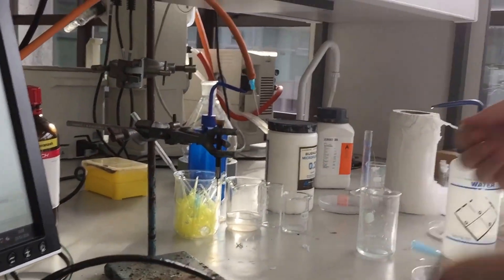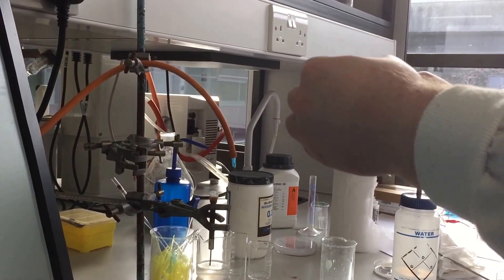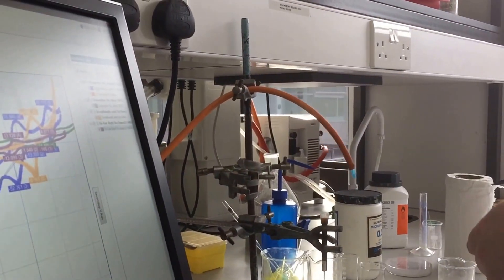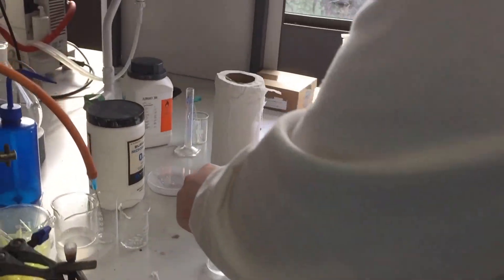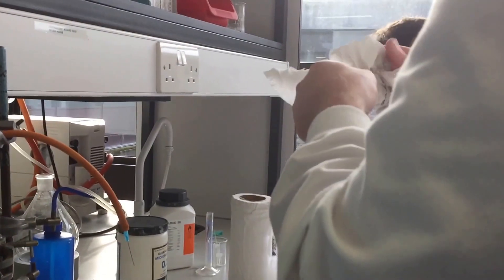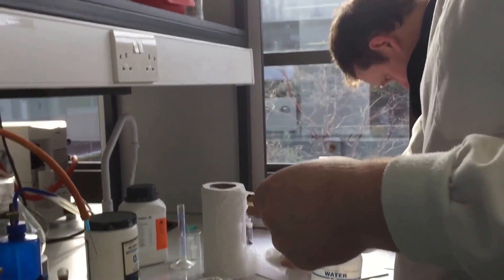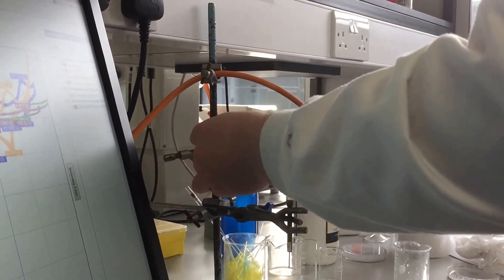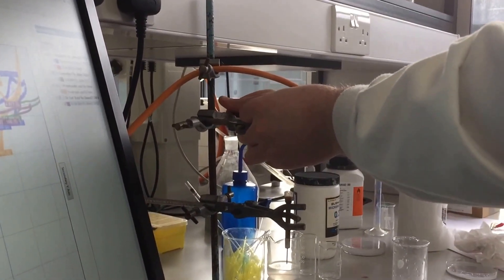So that's one electrode over there. That's the working one. That's the reference one. Alright. So the working electrode is cleaned, and then you put the cell on top with the copper salt and the DMSO and mix it. This one has to wash it up.